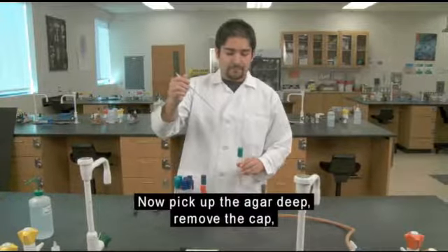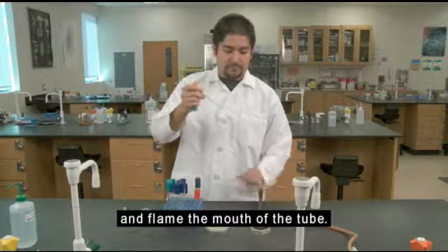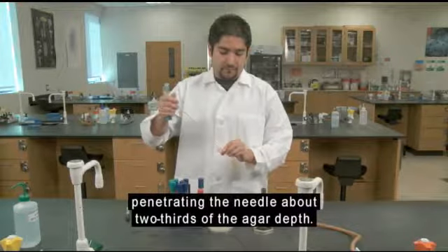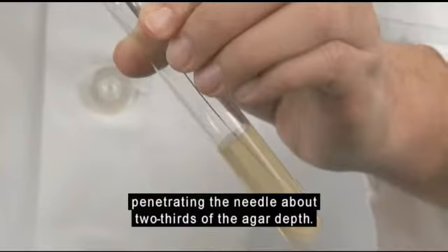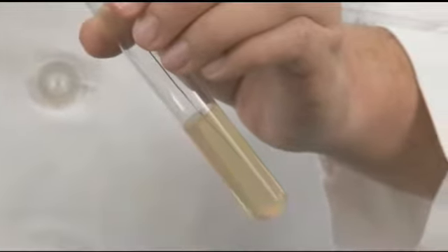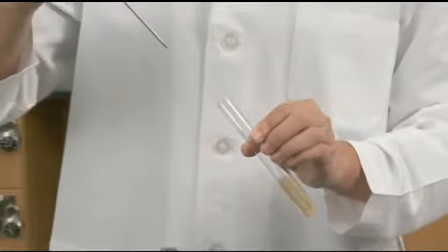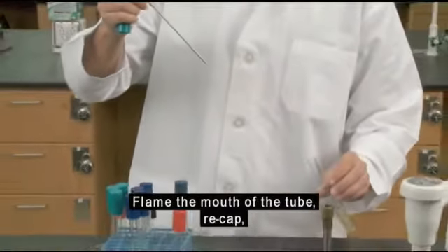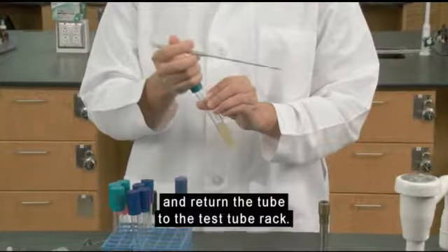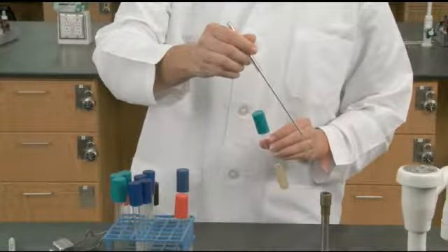Now pick up the agar deep, remove the cap, and flame the mouth of the tube. Stab the agar in the center of the tube, penetrating the needle about 2/3 of the agar depth. Withdraw the needle along the same path as you stabbed. Flame the mouth of the tube, recap, and return the tube to the test tube rack. Flame the needle to destroy any remaining bacteria.